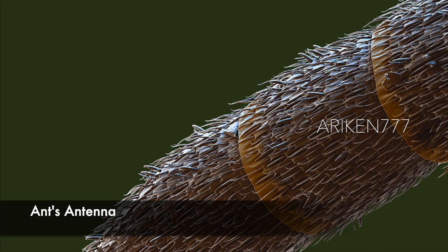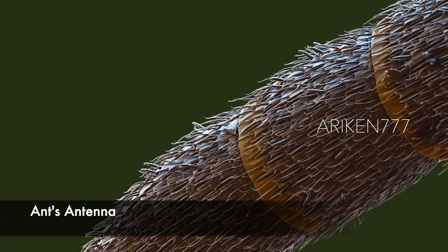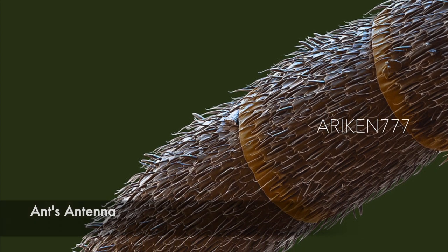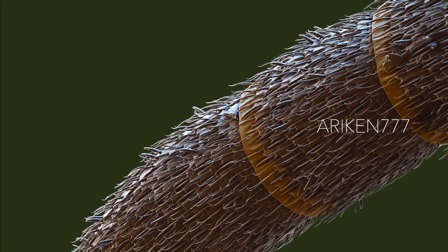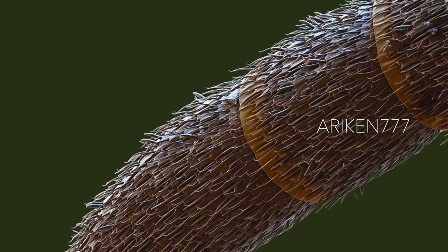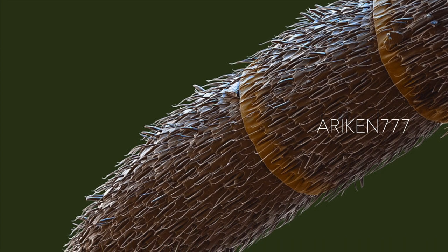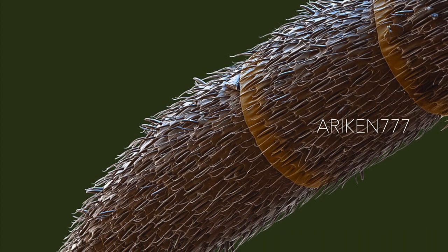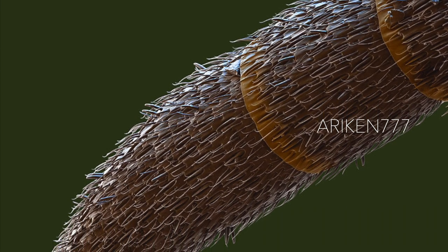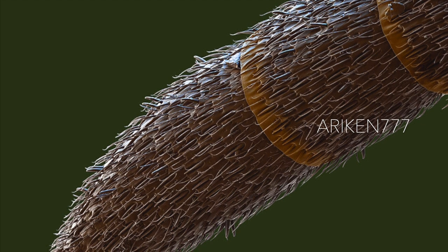The antennae of a European wood ant. The food of this species of ant consists mainly of insects, honeydew and other sweet juices, such as nectar or tree sap.